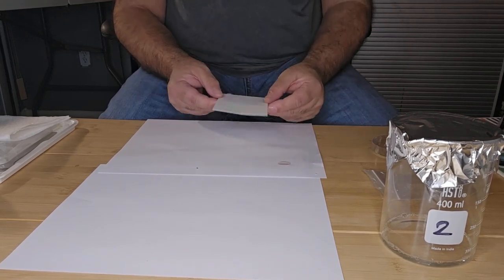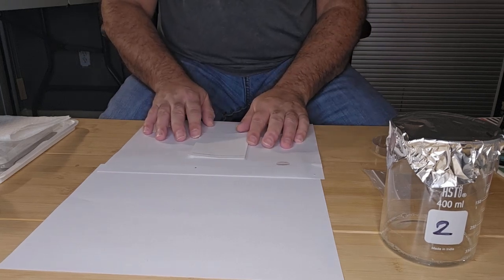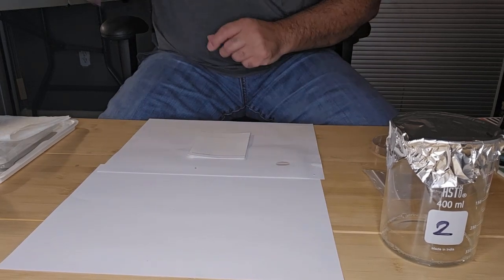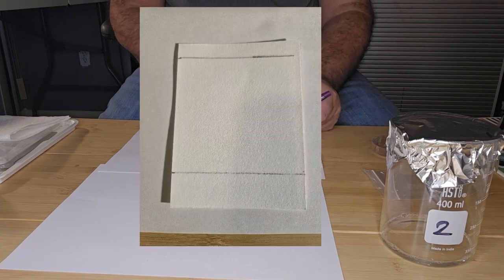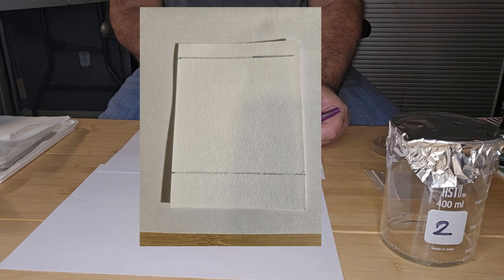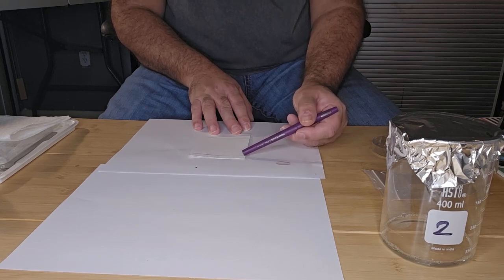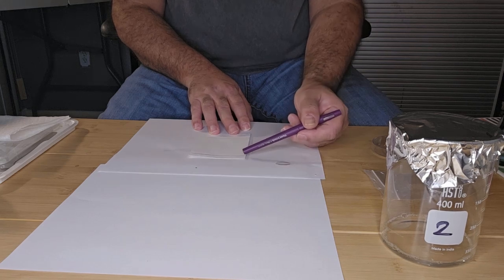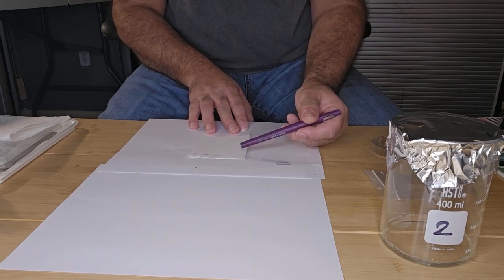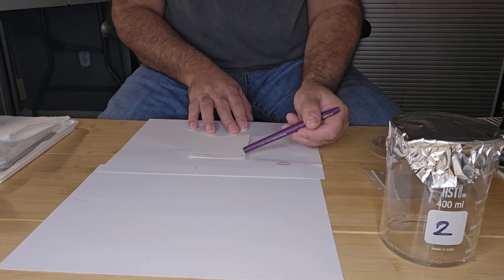On the chromatography paper, you want to mark 2 lines in pencil. From the bottom, 2 centimeters up, you want to draw a line. Then from the top, draw a line that is 1 centimeter from the top. That line at the top is where you want your solvent to develop and move up to. Once the solvent reaches that line, you take the paper out of the solvent to review your results.